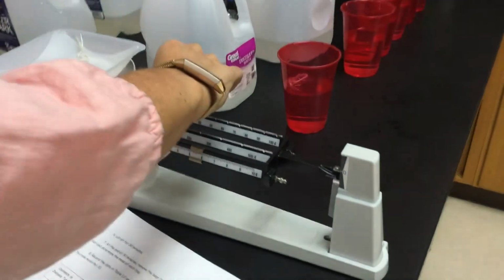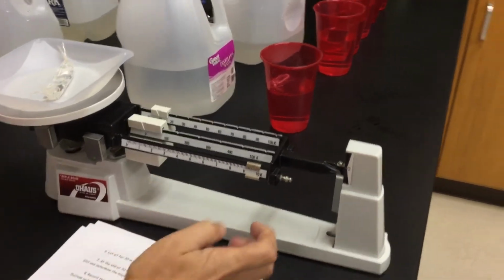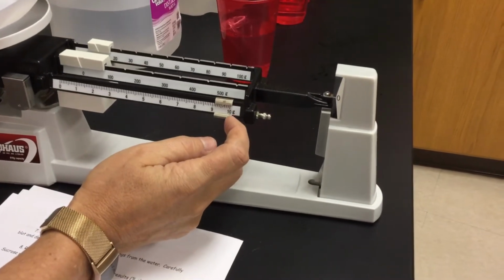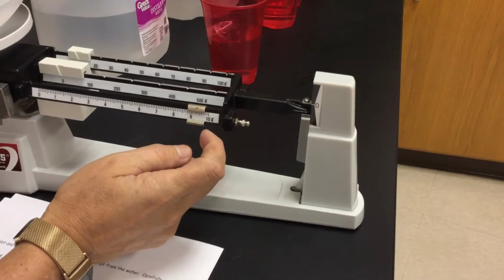So we're putting it in there. You're going, oh, well, it should be about the same. Well, it should be, but maybe I spilled a little bit along the way. Maybe the sugar adds a little bit more to it. So we can't just assume all these bags are going to be the same. Some of the bags are cut a little longer, some are a little shorter.